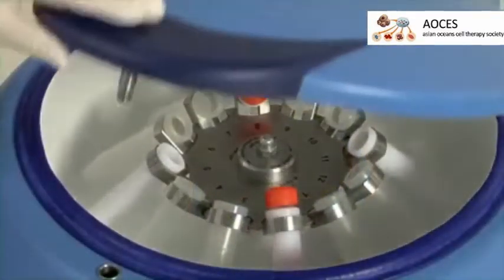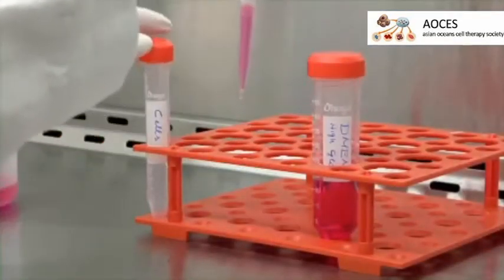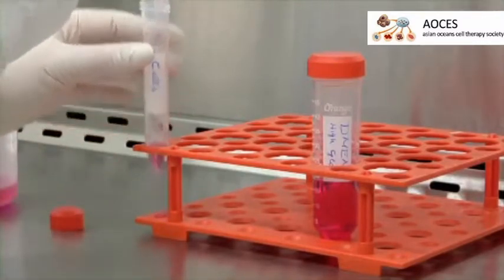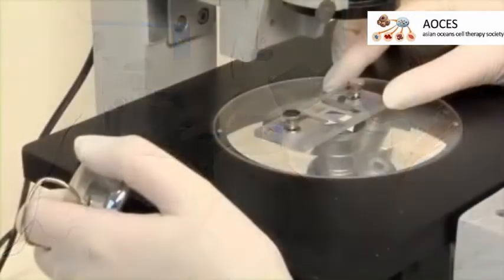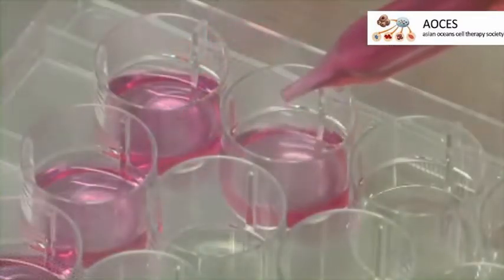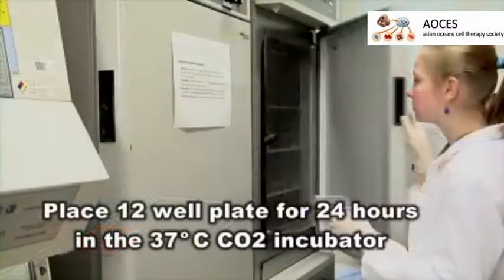Spin down the cells at 1200 RPM for 8 minutes. After removing supernatant, resuspend cells in 1 ml DMEM culture medium. Count cells with hemocytometer using trypan blue staining. Seed 30,000 H9C2 cells per well in a 12-well plate. Place the plate into the 37-degree carbon dioxide incubator for 24 hours.